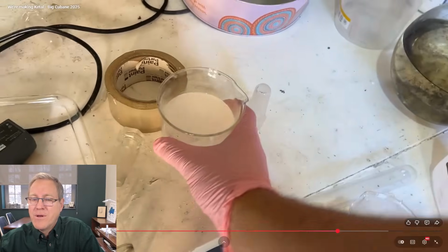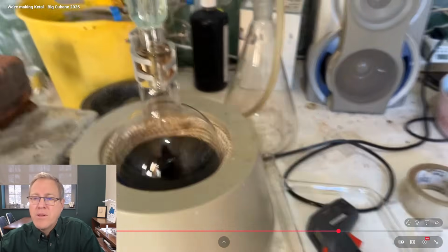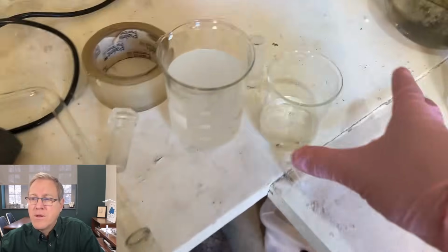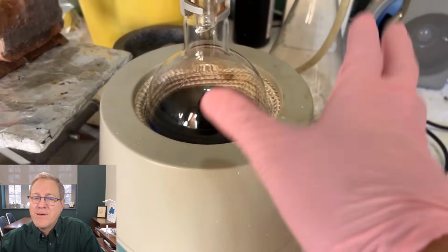Doing a great job. We've removed all this toluene. Here we go. It's 300 mils or so, which is about as much as we put in. So I think there's a little bit left, but not too much. We're just left with a black liquid in the flask. It's not particularly thick. We removed the water, with a little fly in it, and the toluene. So I'm just going to neutralize the sulfuric acid.